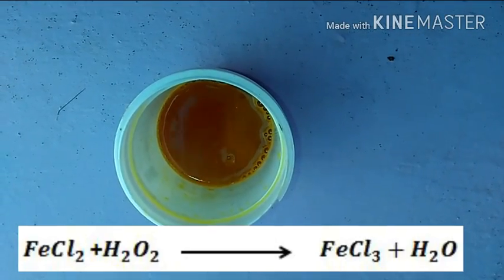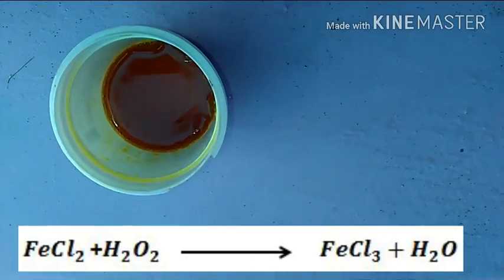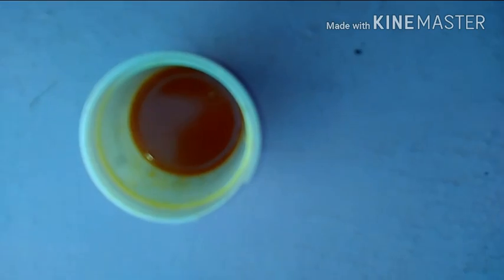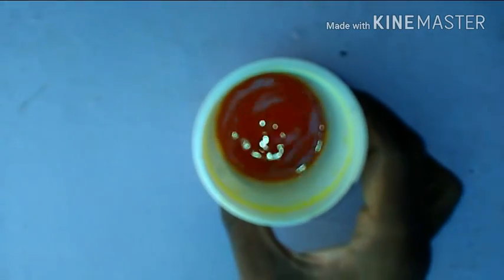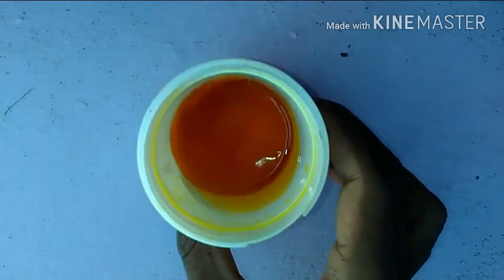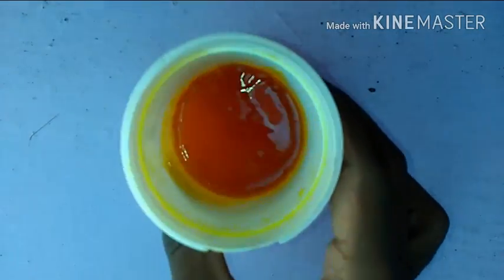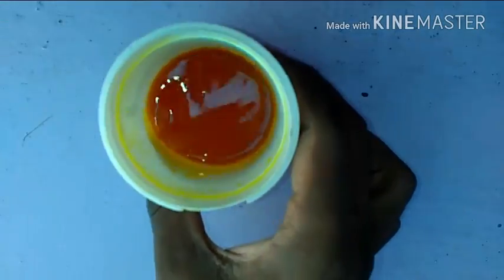Addition of hydrogen peroxide results in rapid oxidation and evolves oxygen. This results in the formation of FeCl3, ferric chloride, a brown colored solution. The bubbles present in the solution are due to the liberation of oxygen gas.